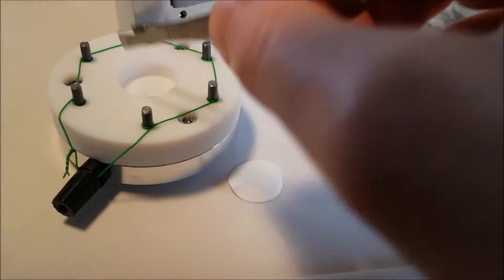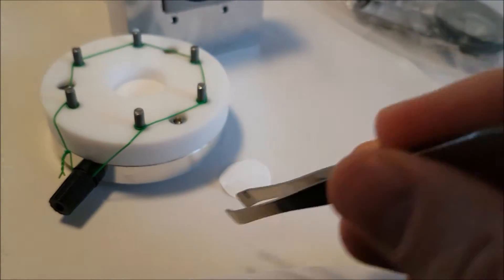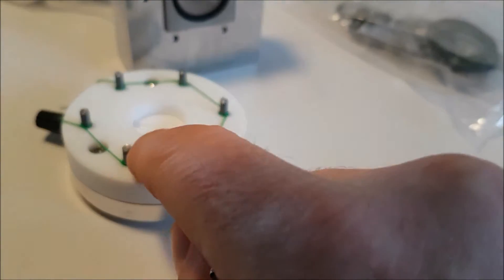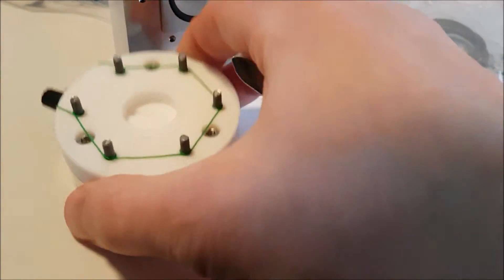So this is the disc, it fits perfectly within here. This is the disc you gave me. And then this piece, ignore all these wires. They just put those on so that these wires don't get loose, you just take them all off.